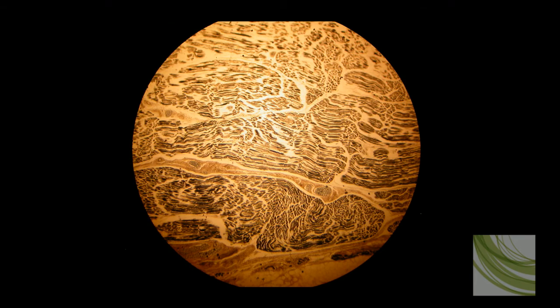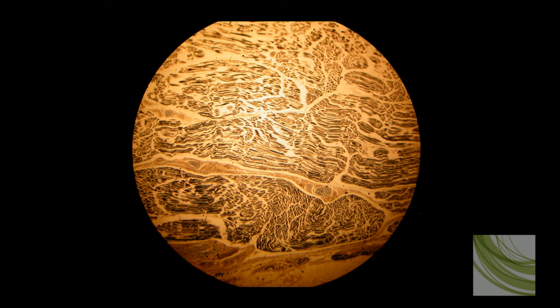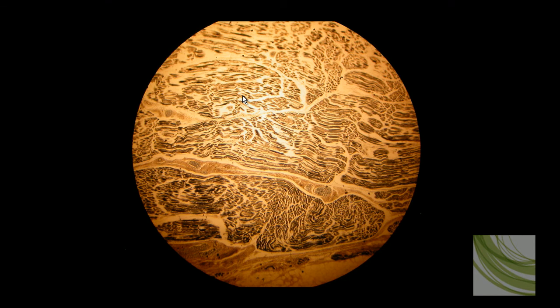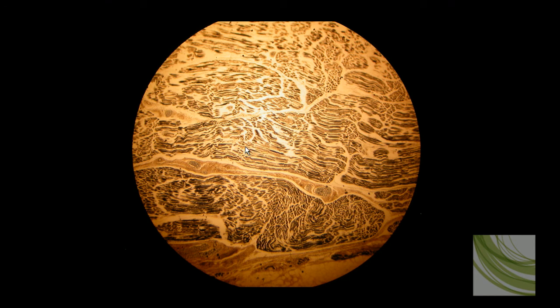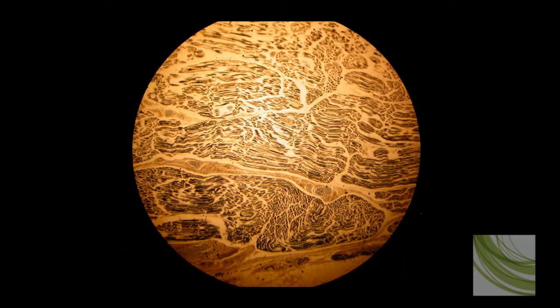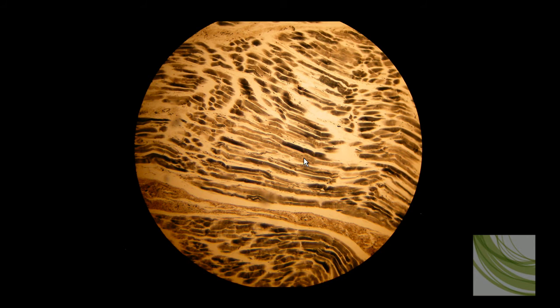Here is a newer slide of skeletal muscle and we can see these long fibers. Unfortunately, it looks like during the process of making this slide some of these fibers got bent. Here is that same slide using the 10X objective. We are starting to see some little bands and striations, and some darker little bends — these are actually kinks in the fiber caused during the process of making the slides.